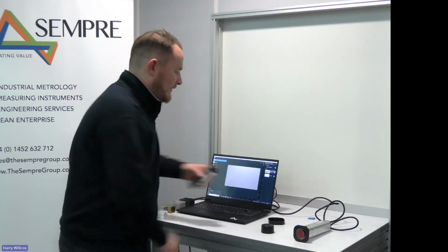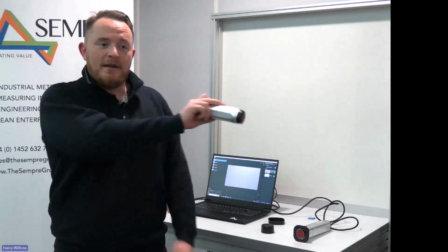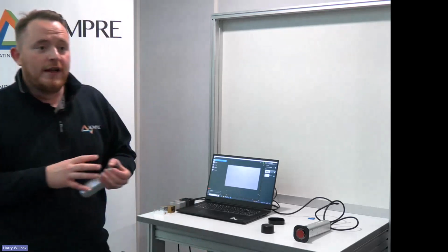So obviously you can see on the Gelsight Max that we're slightly more rectangular shaped. With regards to looking at composite or stitching, I'm presuming that's hopefully what you mean. The system is normalized to itself. So when we're looking at data sets, we're effectively measuring something in reference to another surface. One of the benefits from that is that I can walk around with this in space, and it doesn't matter whether I take a point here, here, or here. The difficulty we have when you look at stitching is that I don't know where I am, so how do I stitch the data together? So unfortunately, on specific measurements, we can't do it.